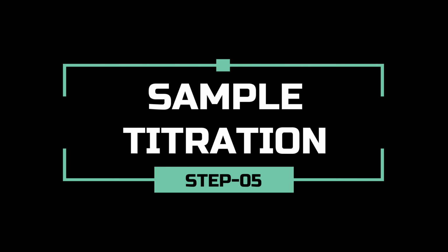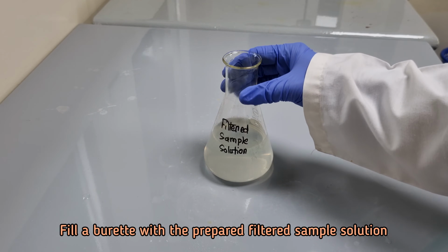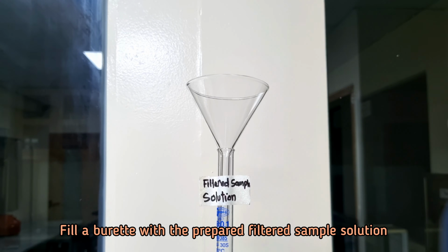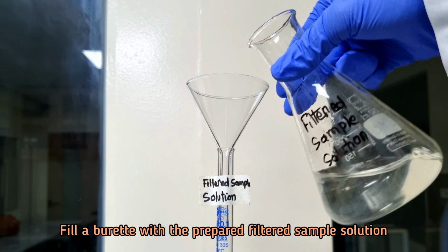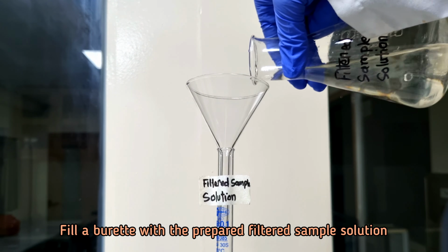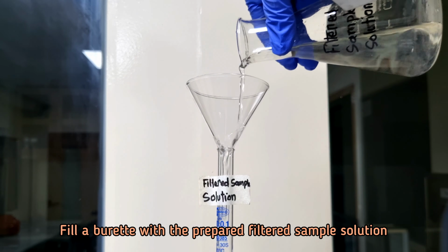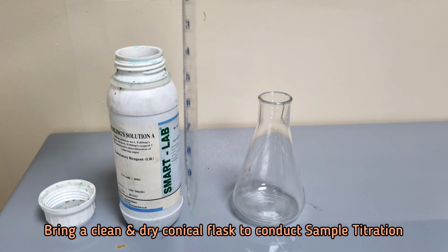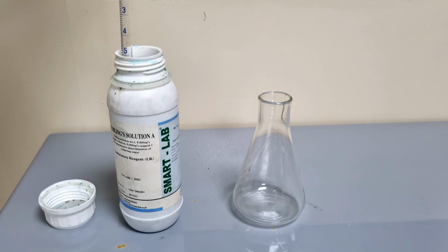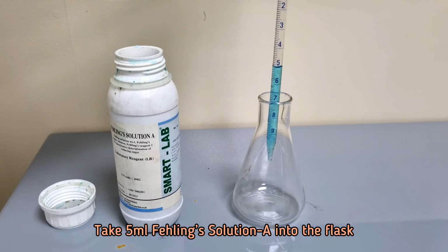Now we will carry out the sample titration. Prepare a burette taking filtered sample solution into it. Take 5 ml Fehling solution A and 5 ml Fehling solution B into a conical flask.